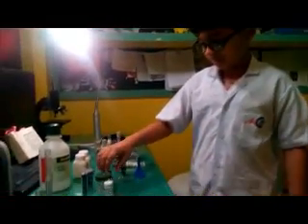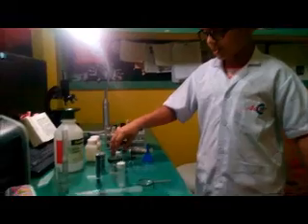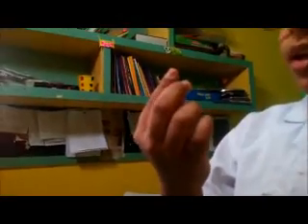I left at fluorescein and we are now going to discuss calcium carbonate. Calcium carbonate is a mineral we find in the form of marble. I have produced this white colored calcium carbonate by crushing these marble stones. As you can see, they contain calcium and carbonate.